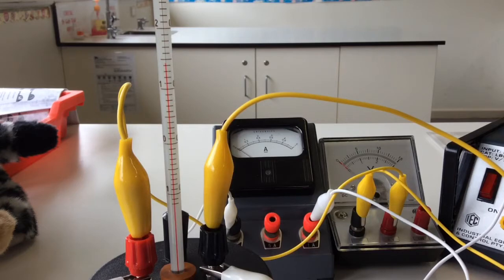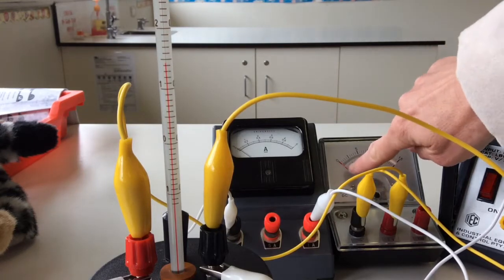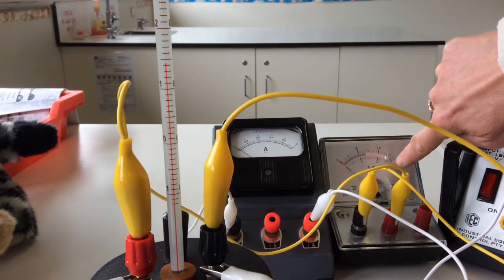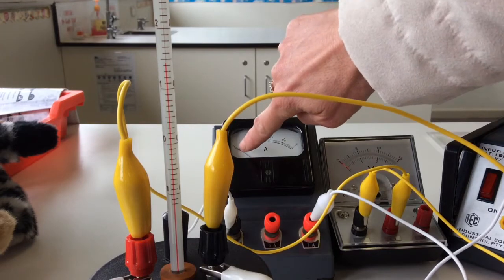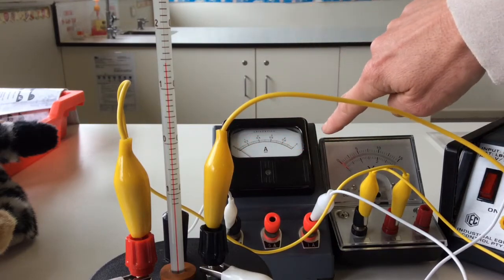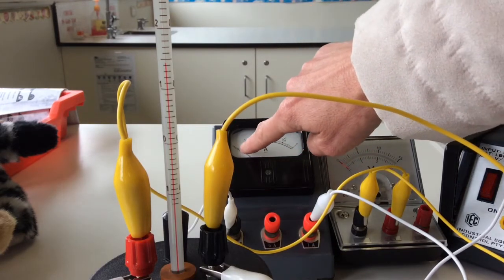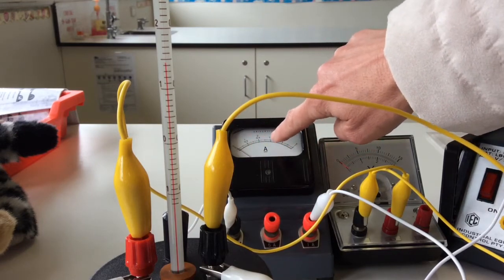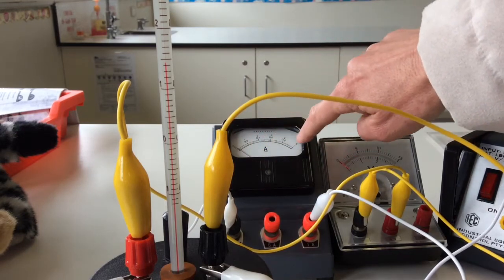It is going to be a little bit hard to see the voltmeter and the ammeter as well as the temperature, but you don't have to measure the amps and the voltage for the whole time. We are using the lower scale on the voltmeter, so it goes one, two, three. And we are using the lower scale on the ammeter, which is pretty hard to read, but it goes zero, point two, point four, point six, point eight, and one.